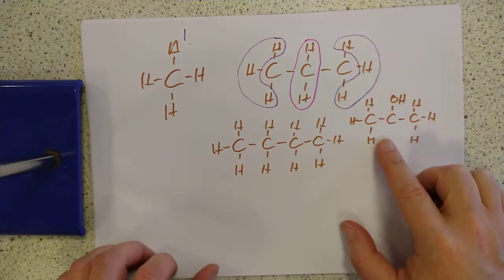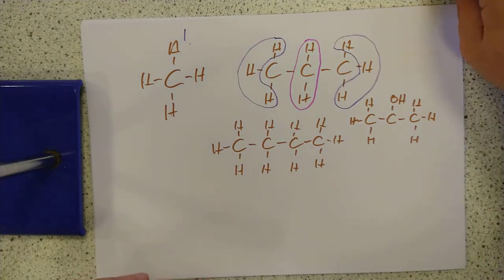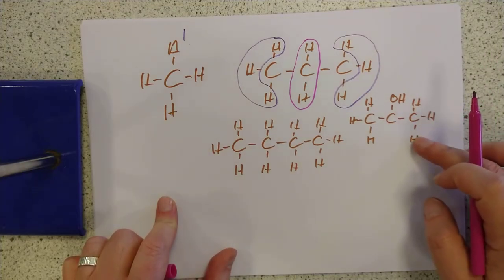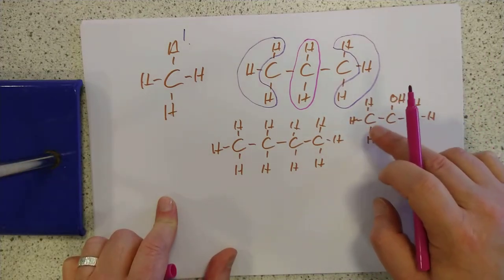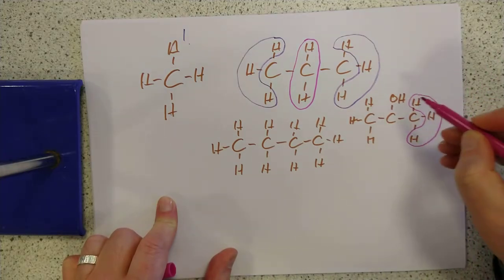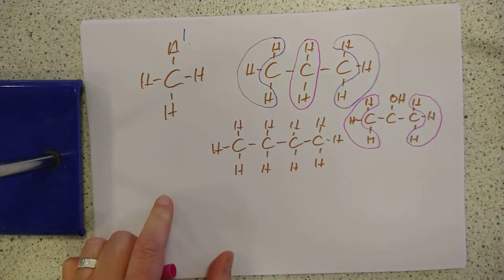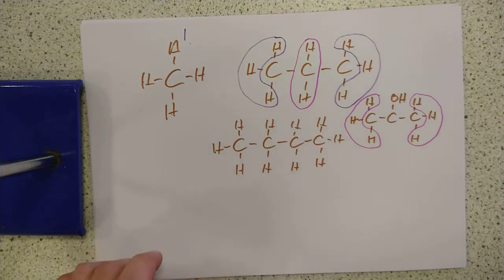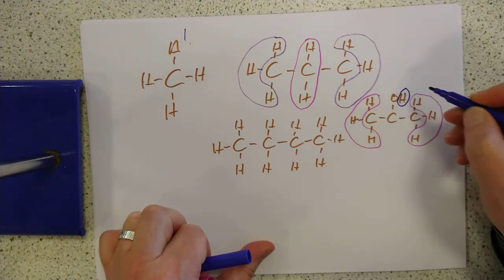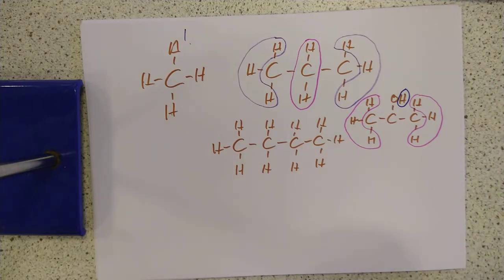Let's do propan-2-ol next. The two CH₃ groups attached to the COH carbon are identical to each other — that's one environment. And of course the OH hydrogen is very much different; it's in its own environment. So there are three hydrogen environments in propan-2-ol.